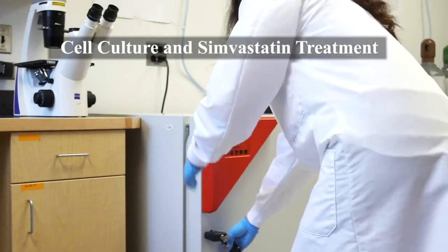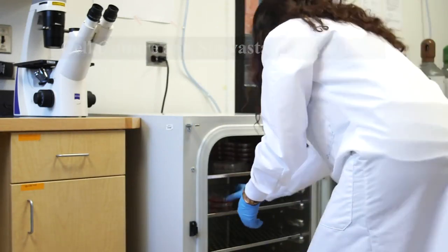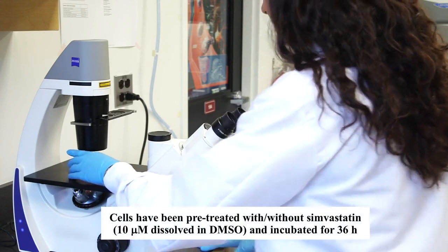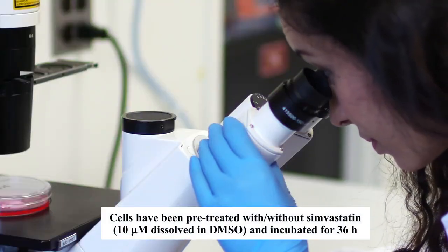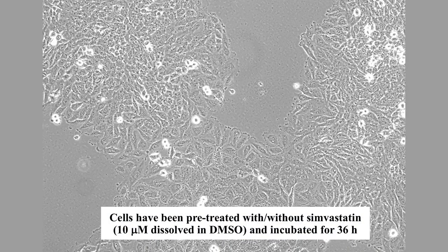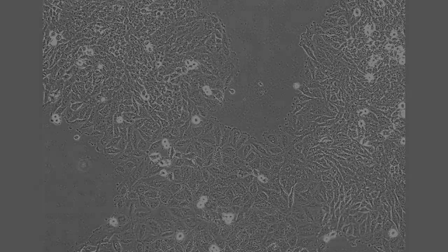Remove cells from the 37 degree incubator. Look at the cells under the microscope to confirm confluency. The cells should be at 70 to 80 percent confluent.